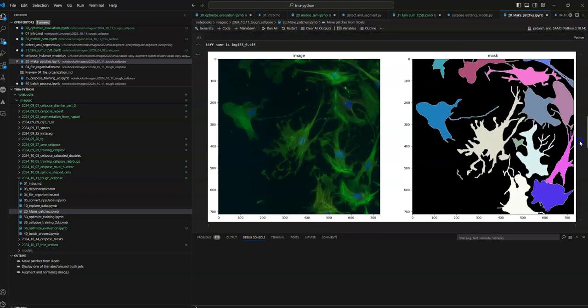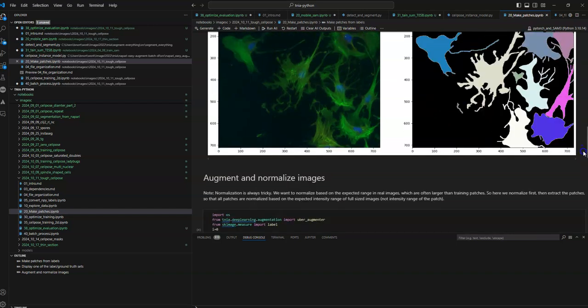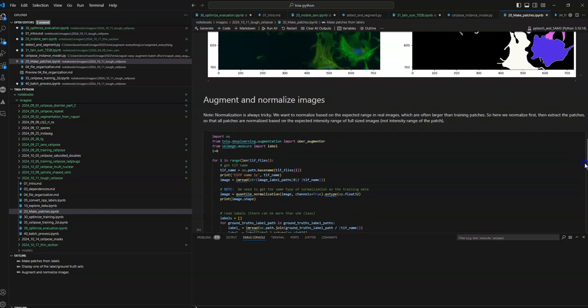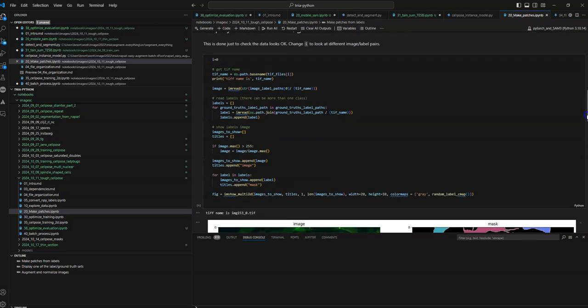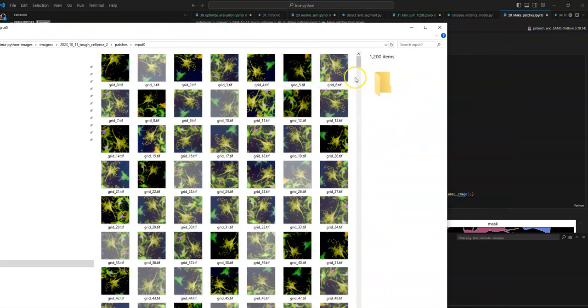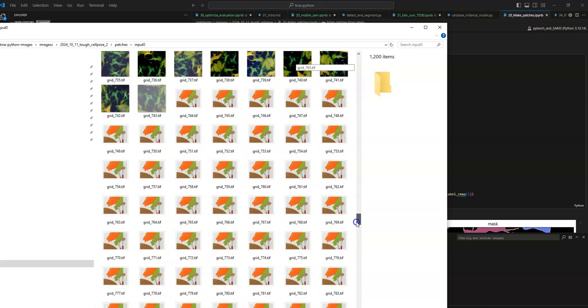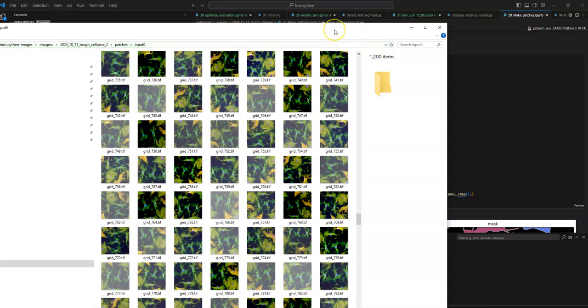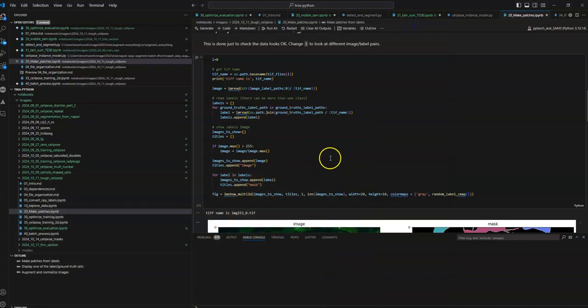And for some problems, it sometimes even makes sense to use larger normalization ranges than you find in the training images, because the images you eventually predict on might have larger ranges than the ones you trained on. And sometimes you can address that a little bit through augmentation as well. So this notebook generates a bunch of training patches, and we can look at these in the File Explorer. You can see there's some variations of the same label, a little bit of intensity variation, which hopefully makes things more robust. As I said before, this step is often hidden. A lot of times maybe it doesn't make sense to waste so much disk space on all this, but sometimes it's useful to look at for troubleshooting. So that's the way I usually do things, that's to make patches.